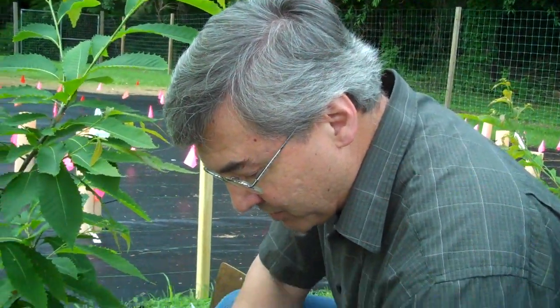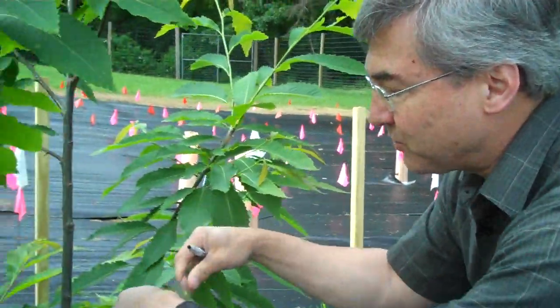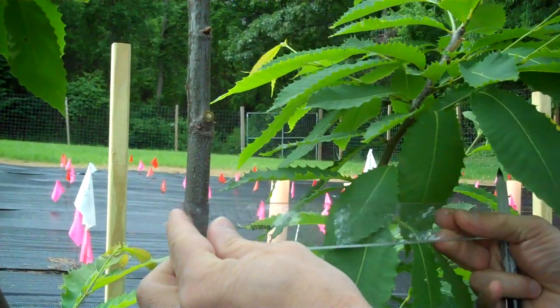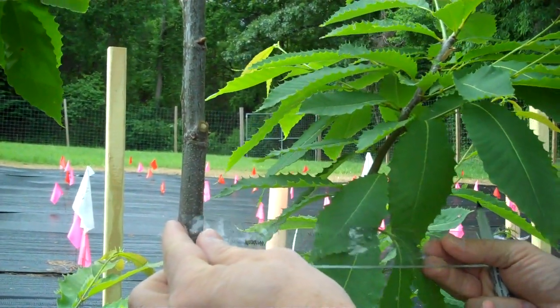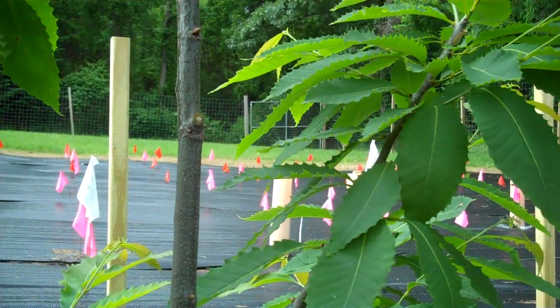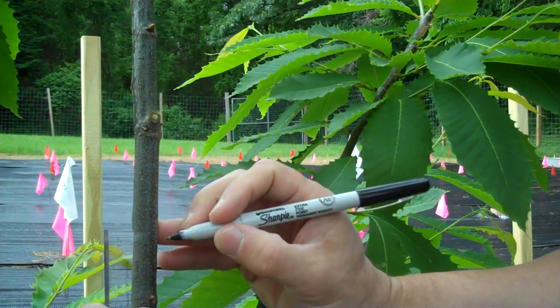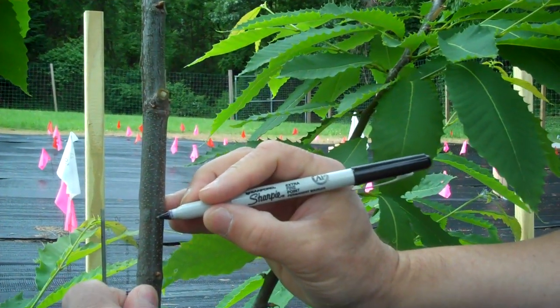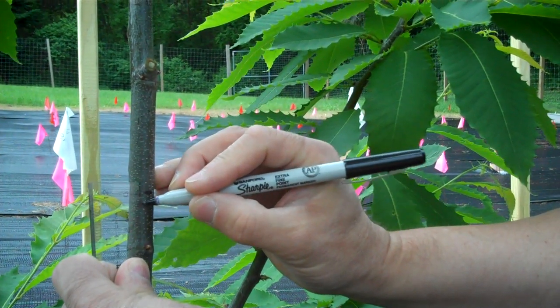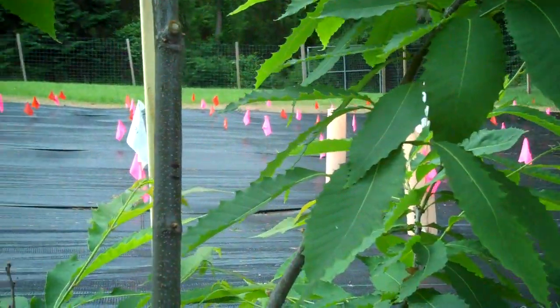The first thing I'm going to do is pick an area that I know is the right size — that's about 1.4 centimeters or so, good enough. Then I'm going to make a mark that's half a centimeter apart, like that.